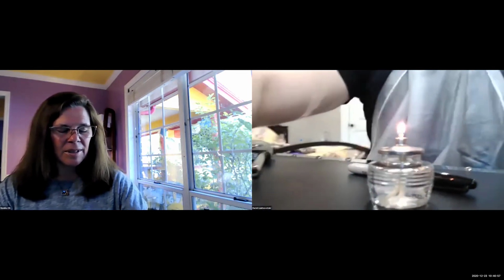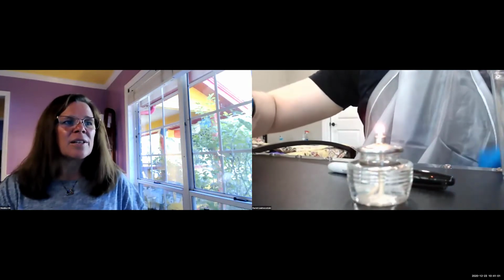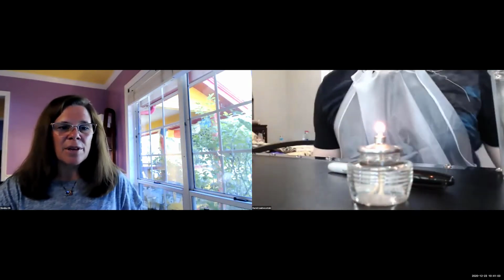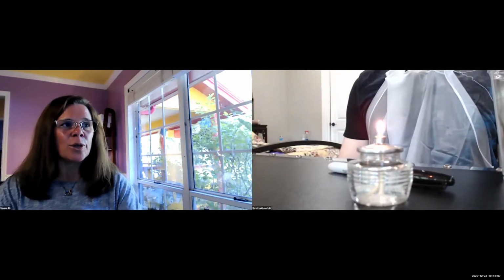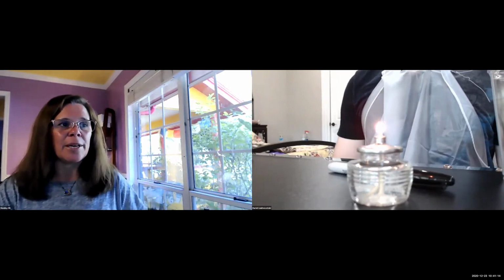Okay, so I'll put this down and let me put the camera in the same position I had before, so we can see my desk. Point it down. There we go. So the key thing for microbiologists, whenever you open any tube or any bottle, you always quickly hold it over the flame so that the mouth of the container gets sterilized and you don't contaminate your culture.